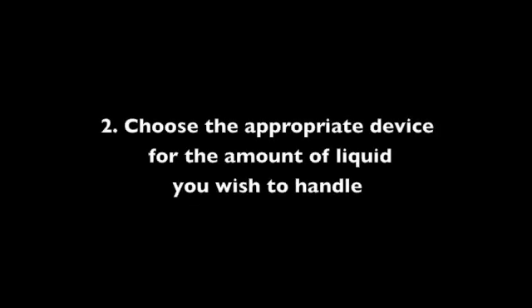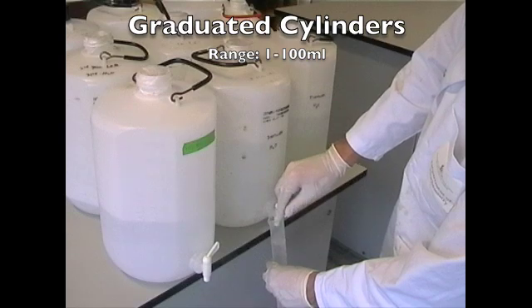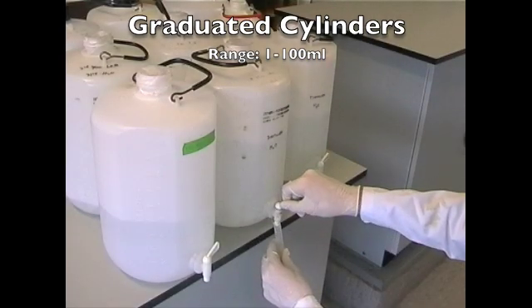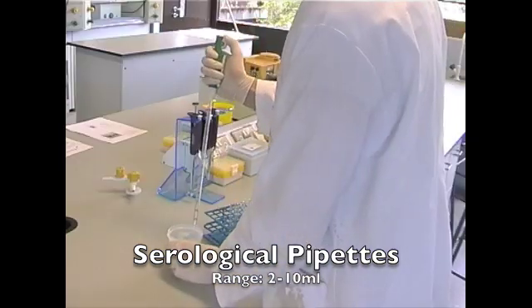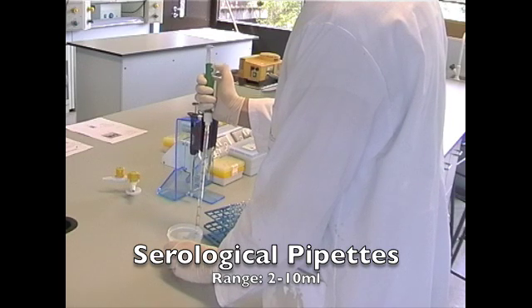When dealing with liquids, it is crucial that you choose the appropriate device for the amount of liquid you wish to handle. Graduated cylinders are used to accurately measure out volumes of chemicals for use in reactions. They are generally more accurate and precise for this purpose than beakers. Serological pipettes have a range of 2 to 10 milliliters. They are filled by attaching a pipette filler to the top of the pipette, immersing the tip in the liquid, and rotating the wheel until the desired volume is within the chamber of the pipette. They are emptied by rotating the wheel in the opposite direction.